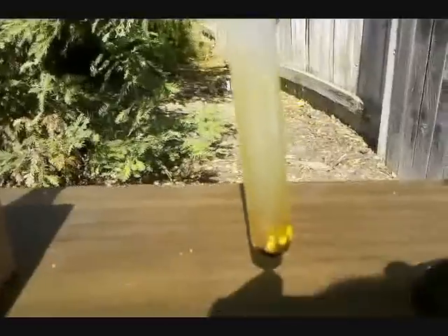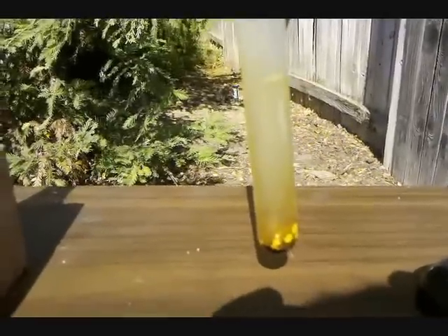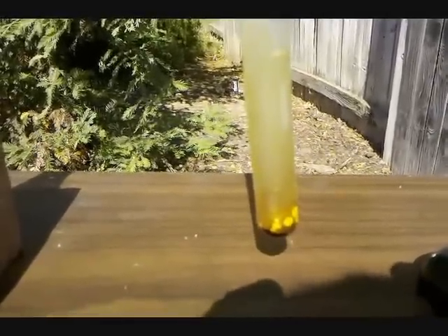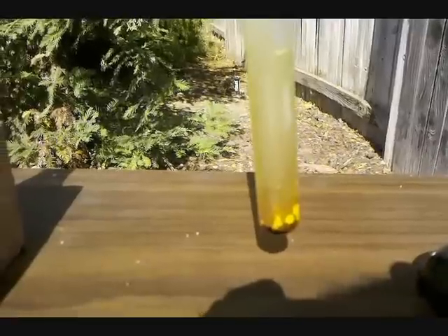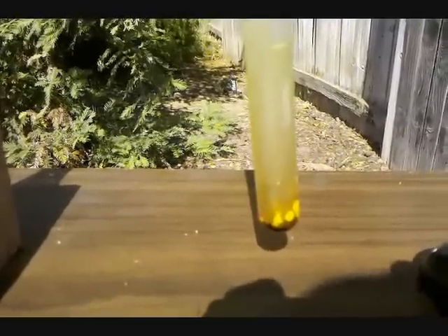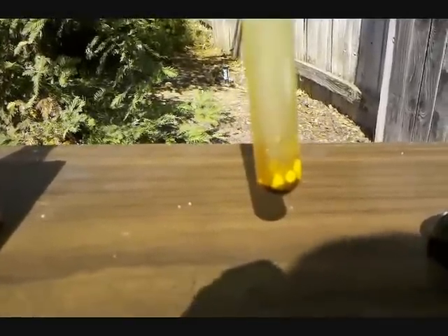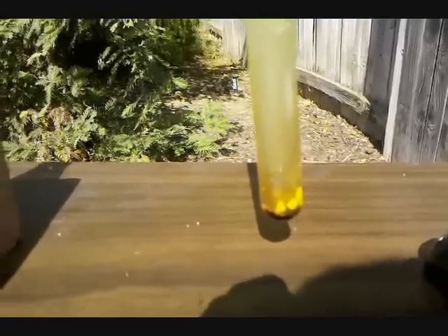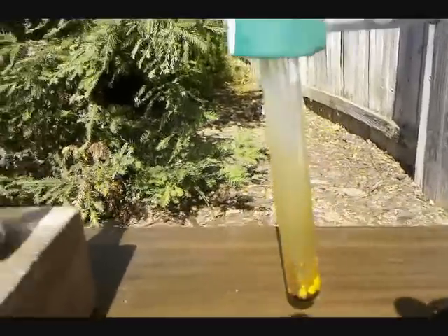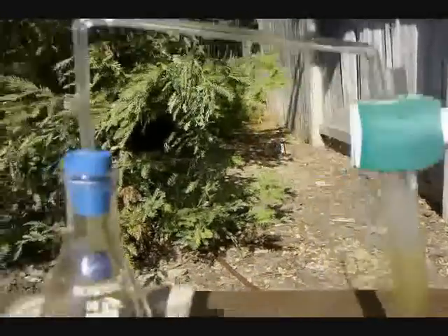Also, yellow crystals and a yellow gas are formed. I believe these are iodine trichloride, because with excess chlorine the equilibrium favors the production of iodine trichloride. Also, the smell of chlorine gas is very evident, so it is required to do this outside or under a fume hood.